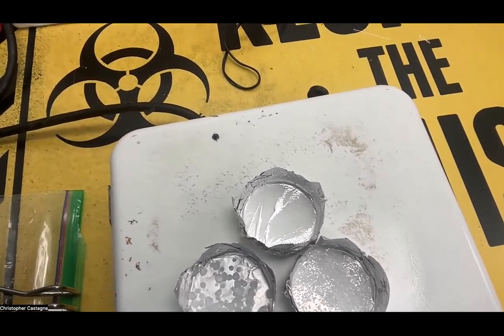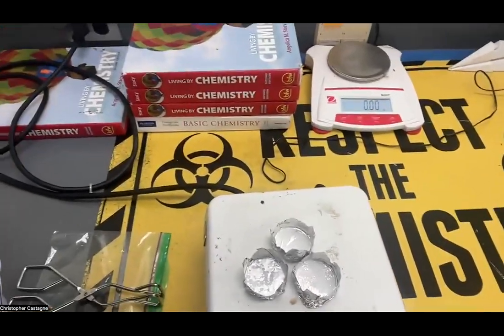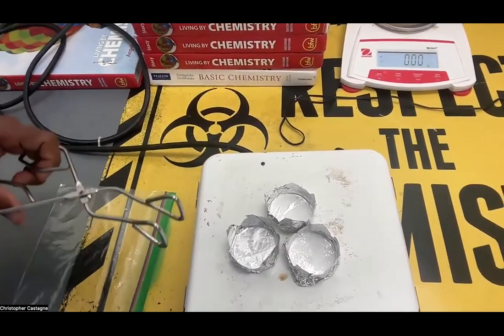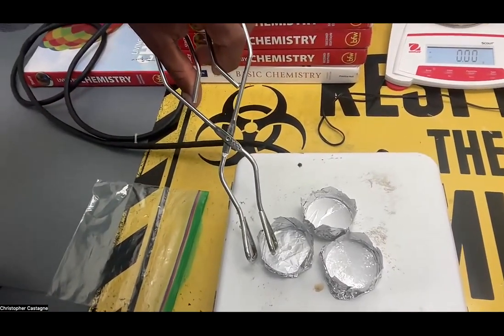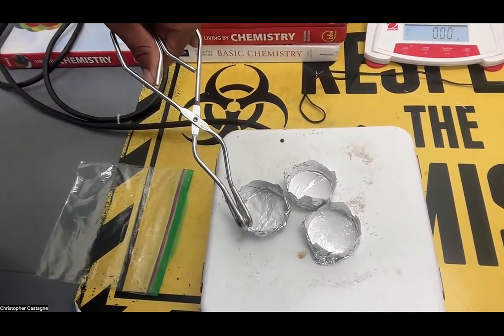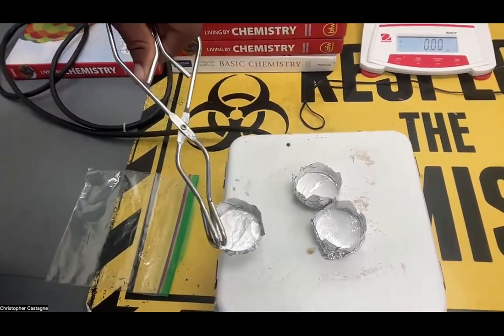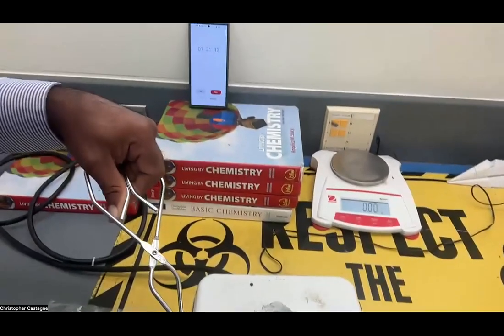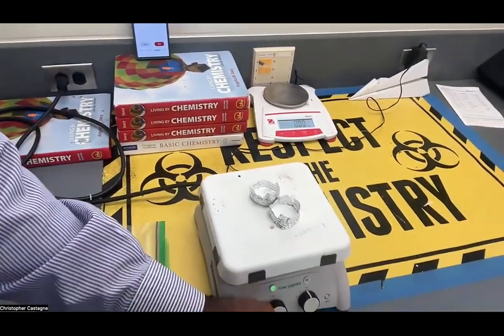We don't want to leave this on for too long because it will start to actually burn. We're trying to get a physical change, not a chemical change. It's pretty much all melted, so I'm going to take it off. If you start to see smoke or a color change, that means it's a chemical change — it's beyond melting, it's burning. It's been about one minute and B is all melted — that was the first one to melt.